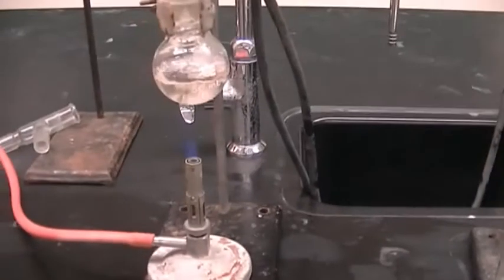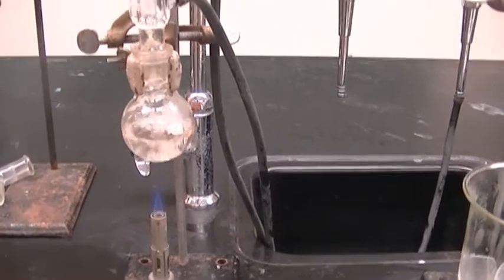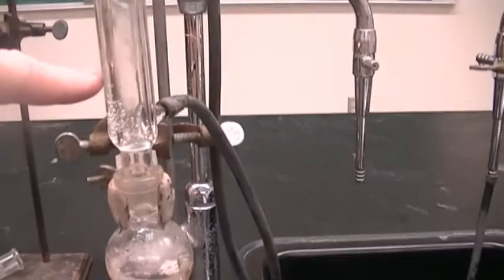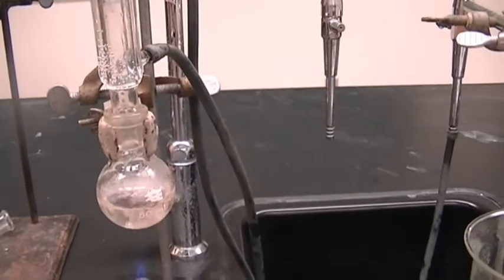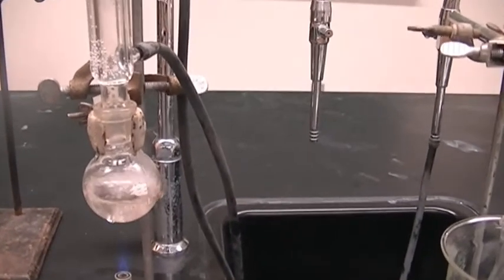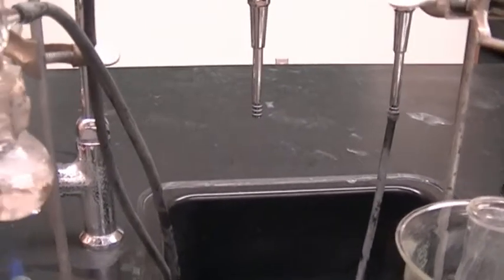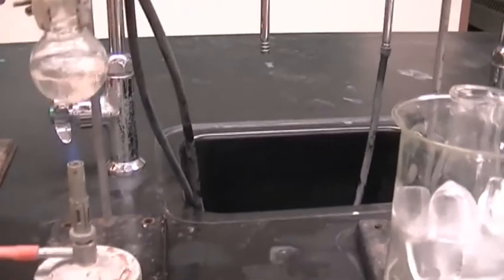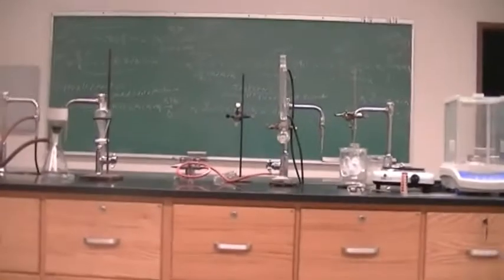It is simply the flame boiling the solution. The solvent front is about there-ish, and then it's coming back down and dripping in, and this has been happening for an hour. Again, it's not going to go dry because the liquid just goes right back in. It is not going to go out through the top. All right, and so that is a reflux, boiling without losing the solvent.